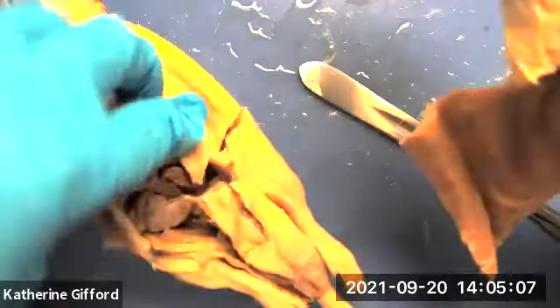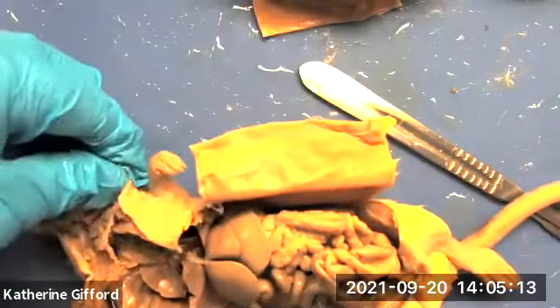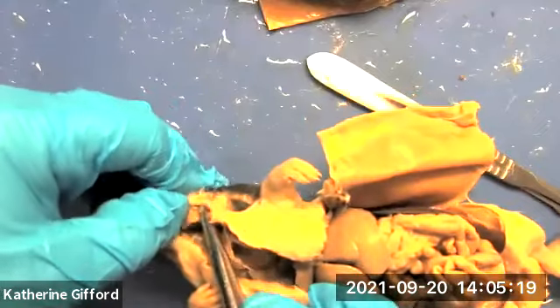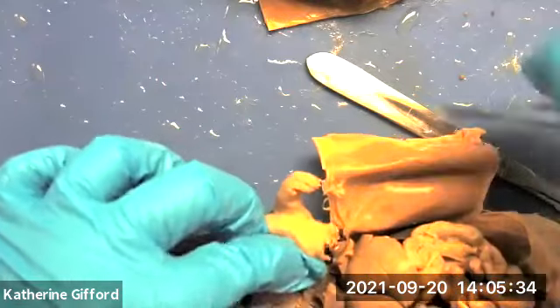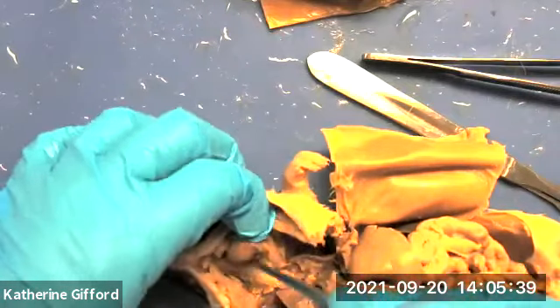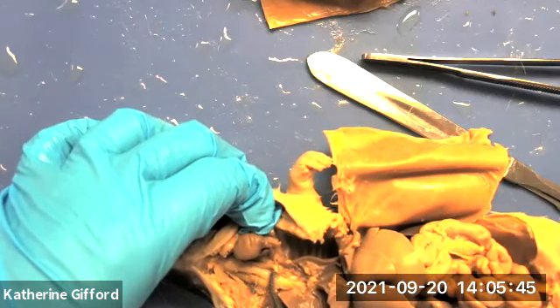Now if we take a look at our female rat, you can again see the submandibular gland here in the throat. The parotid gland would be closer to the ear. Next to the trachea would be the esophagus.